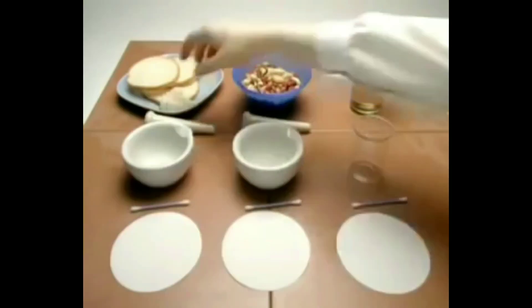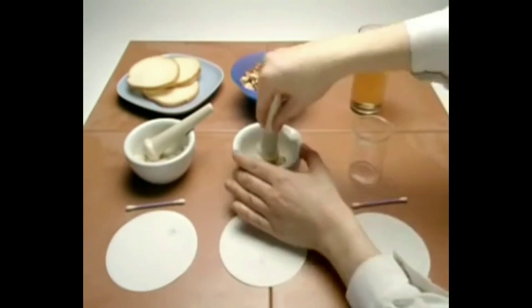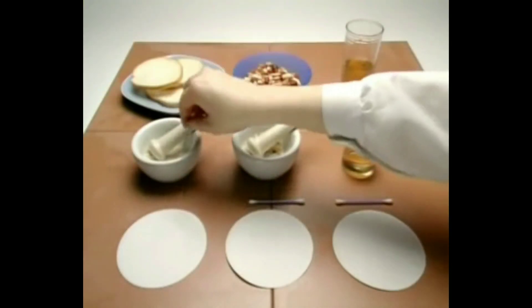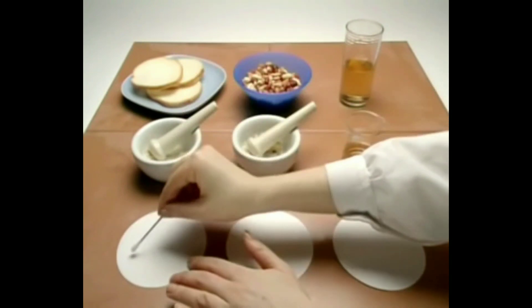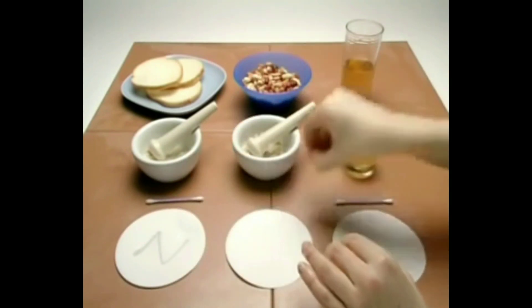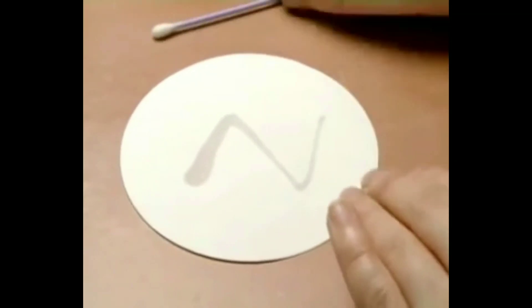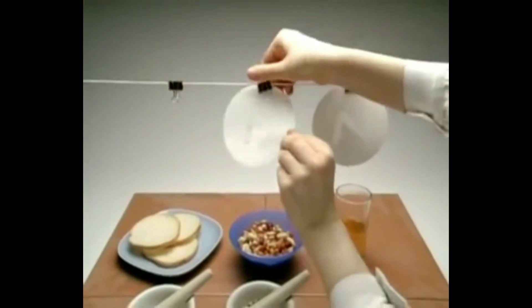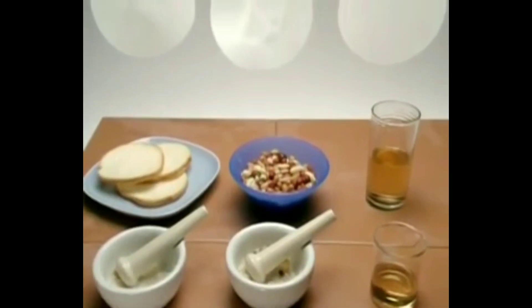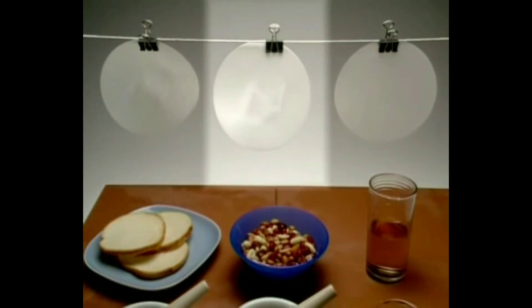To find out if any of these foods contain fat, first grind the solid food samples in distilled water. A small amount of the liquid from each sample is then smeared onto a filter paper and left to dry. They all look translucent to start with because they're wet, so it's important to leave them to dry for a few minutes. Here are the results: only the nuts contain fat.